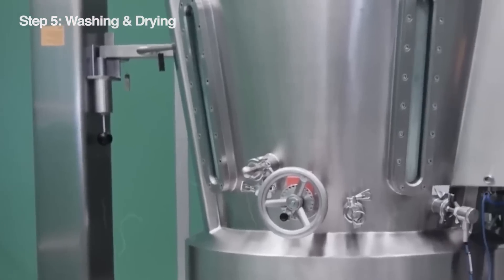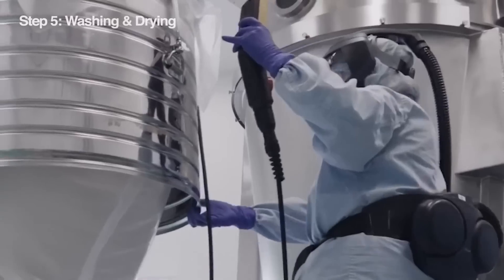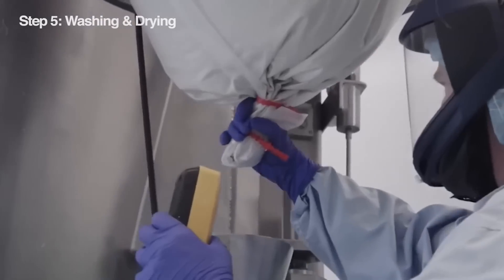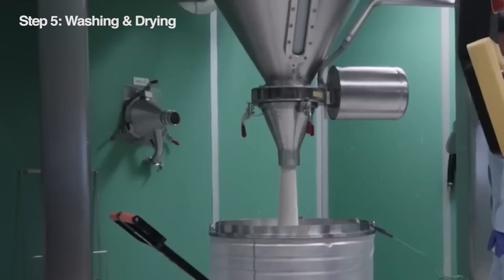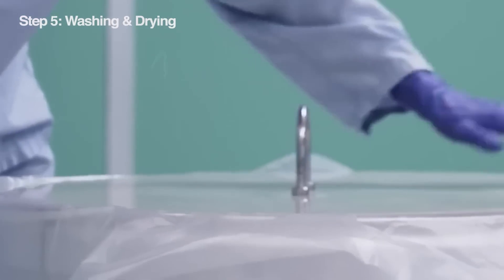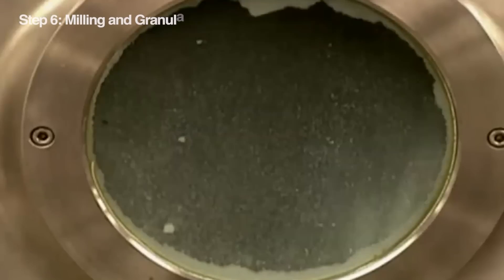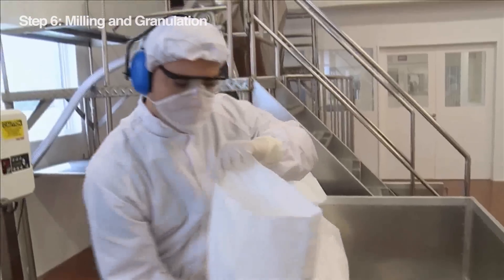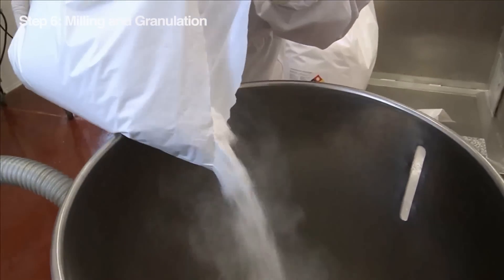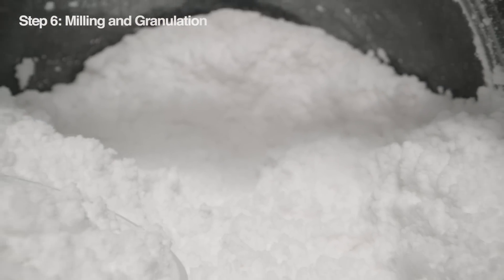Ready for the next step? Drying. The contaminated solvent or water is drained carefully. The aspirin can be left to air dry or be rotated inside a rotary dryer. Whichever way is used, the target is to remove excess moisture to get perfectly dried crystals. Now that our aspirin is all washed and dried, it's ready to be refined further. It's time to toss it into a milling machine to make sure all the particles are the same size.